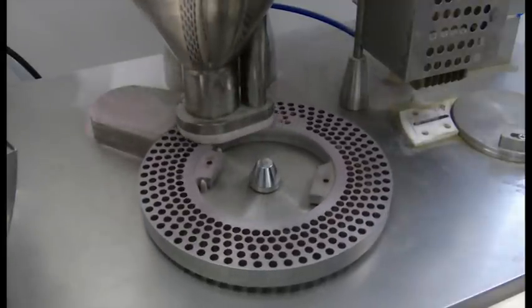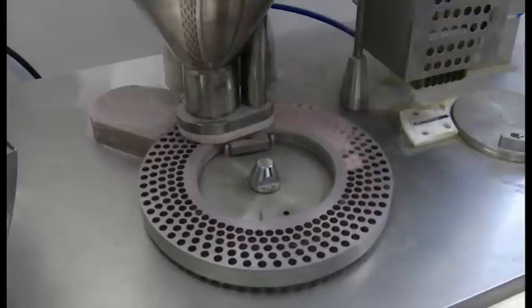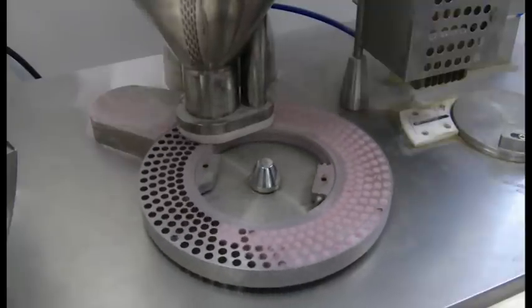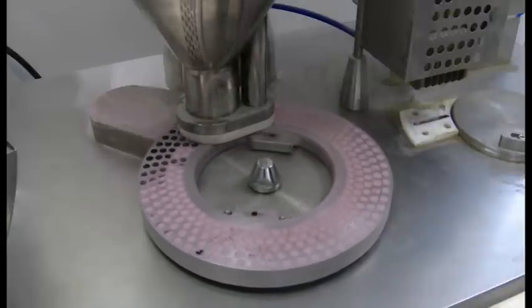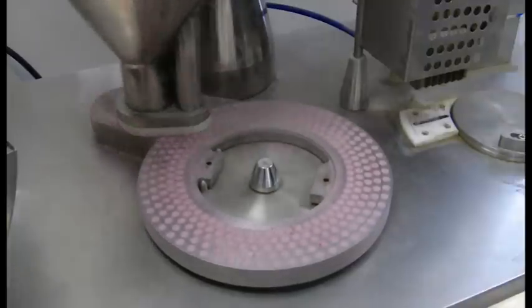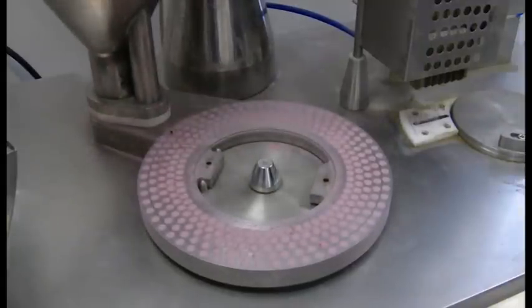This causes the filler to slide across onto the capsules and the capsules to rotate beneath it. The corkscrew then evenly forces the powder down into the capsules. This ensures that each capsule is of the same size and weight.